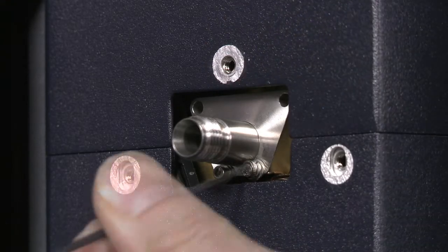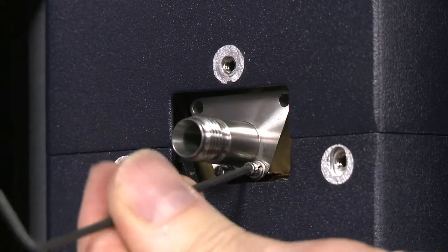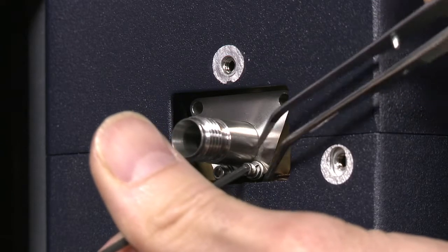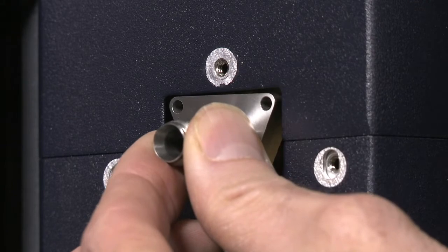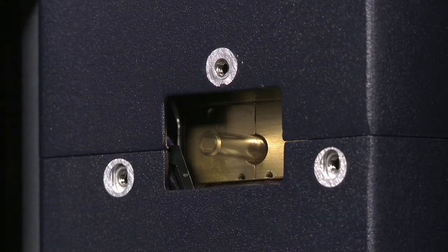Next, remove the three screws that hold the outlet fitting in place, and carefully remove the fitting by pulling straight out from the furnace, exposing the quartz furnace tube.